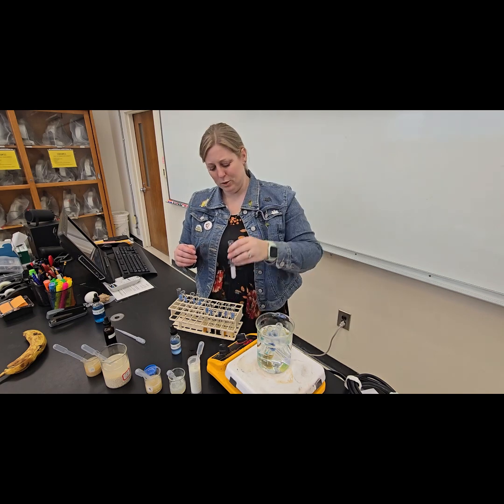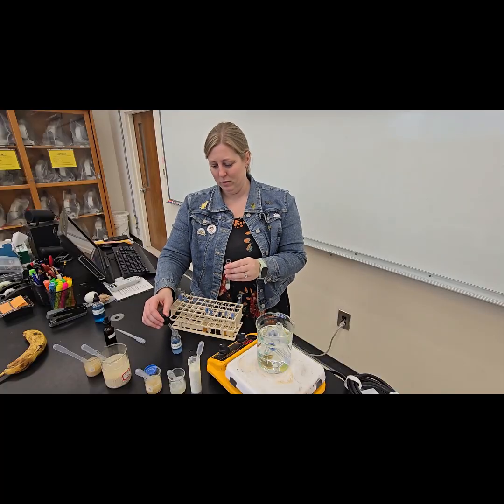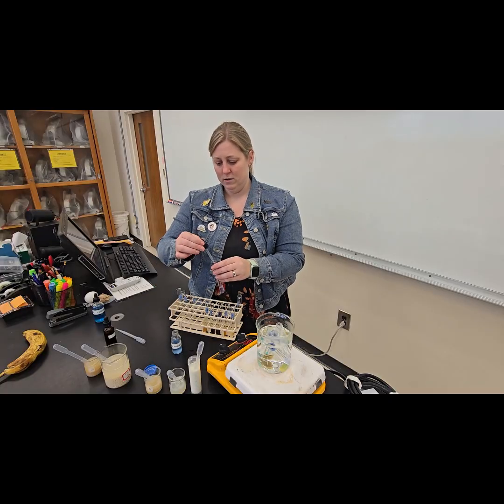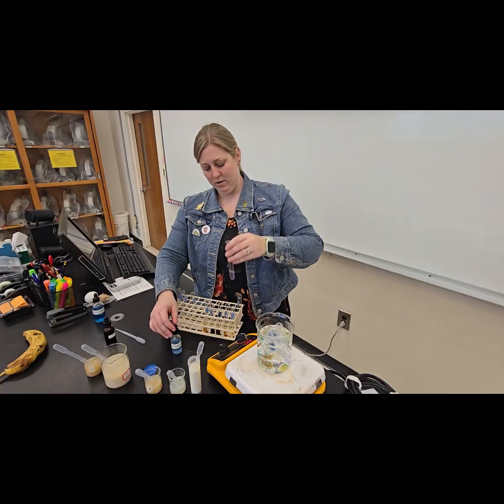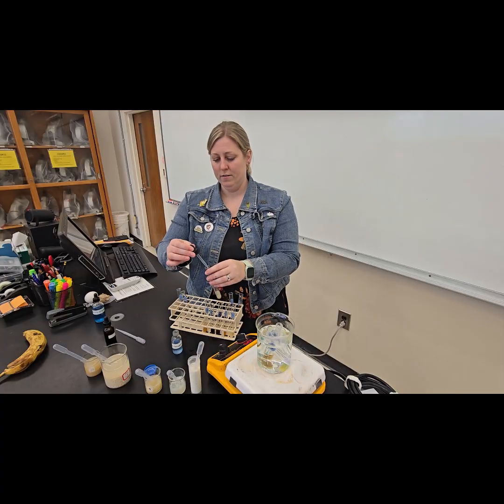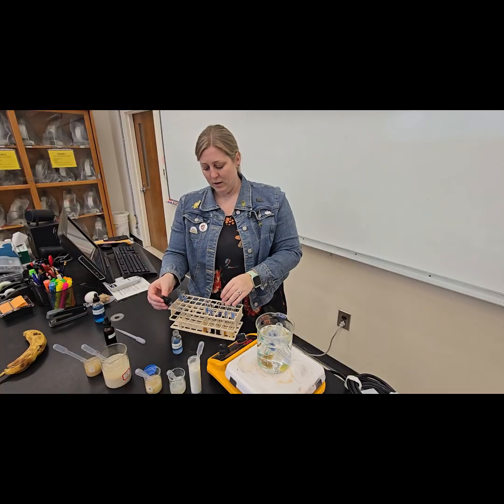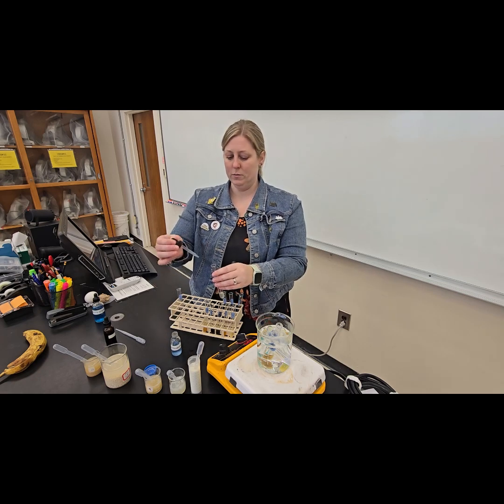It's light purple, so I'll let you guys interpret that. So milk turned a light purple. Here is our egg white. Okay, we should get a result there. Banana. I don't know if we'll see protein in banana, but let's find out, test that hypothesis. Okay. Rice water. Let's see what we get for rice water here.